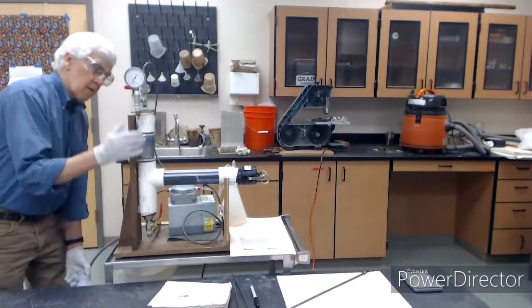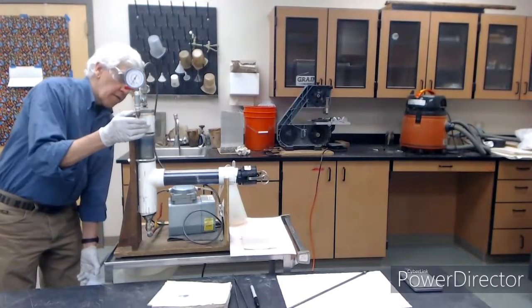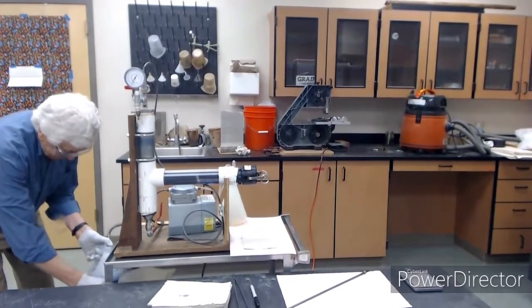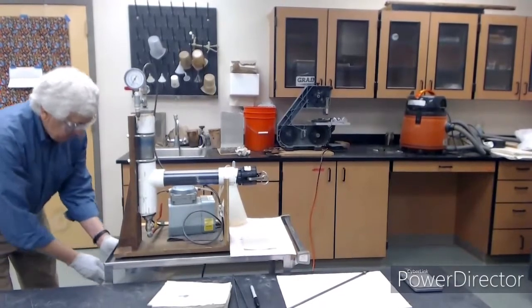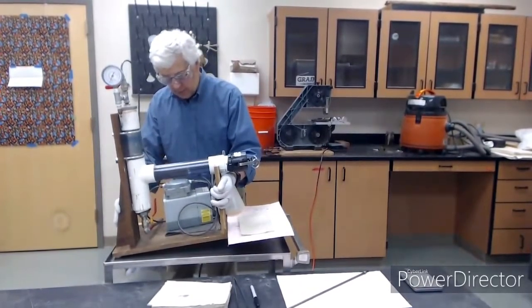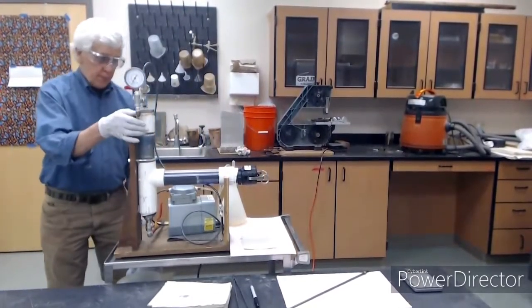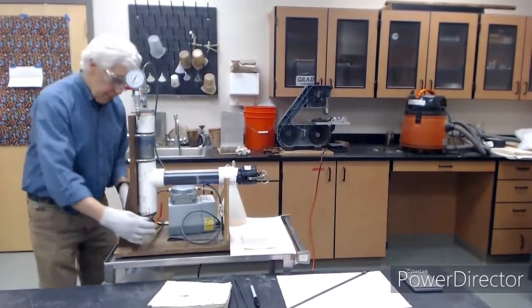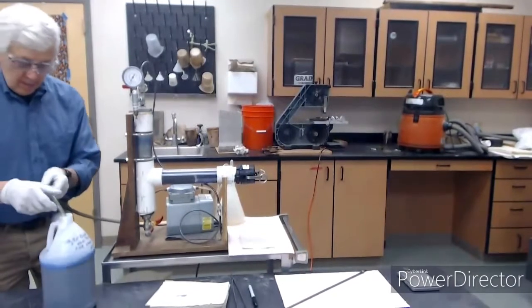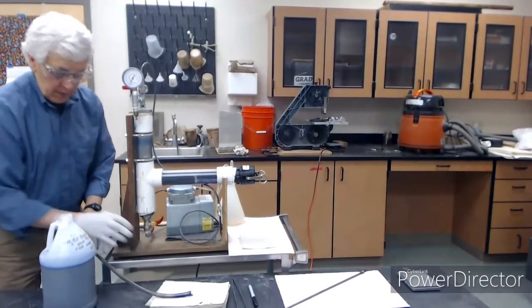Get this all the way open. And it looks like we have drained everything. Put this in here. Lift this up a little bit. Try to get some of the liquid drained. All right, let's close this. There.